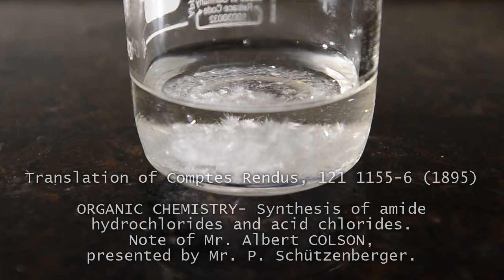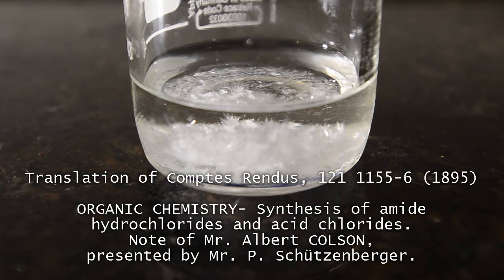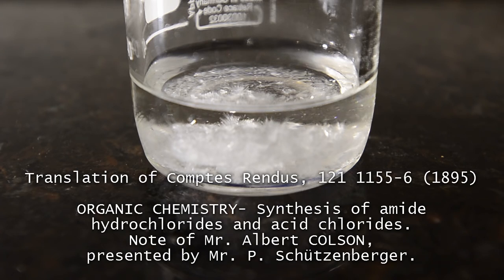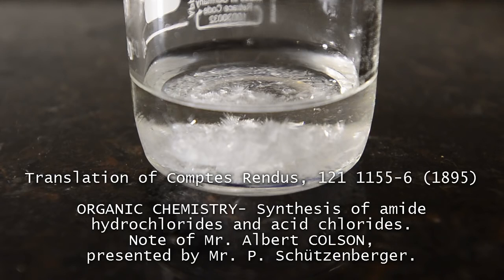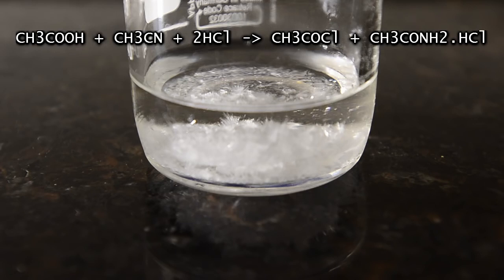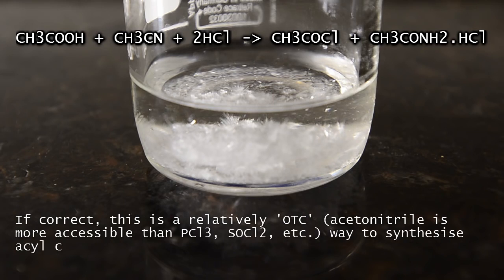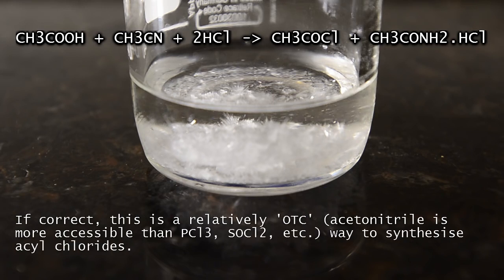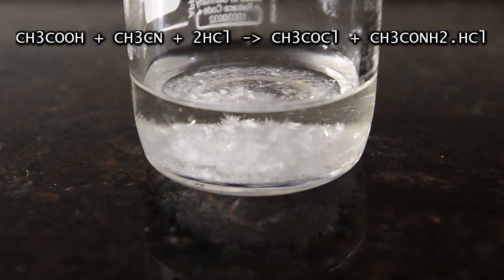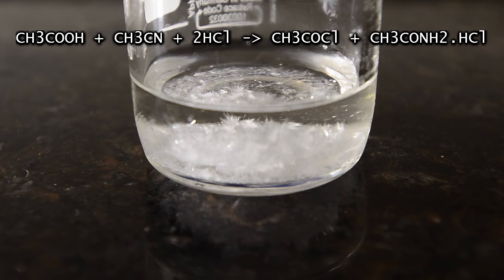We read about a very interesting reaction: an organic nitrile in the presence of a carboxylic acid and hydrogen chloride gas will apparently dehydrate the acid, forming an amide in the process, while the corresponding acyl chloride is produced. We did a test and bubbled HCl gas through an equimolar mixture of acetonitrile and acetic acid at room temperature until no more would dissolve. The resulting solution was left overnight and cooled, yielding crystals exactly as the reference said it would.